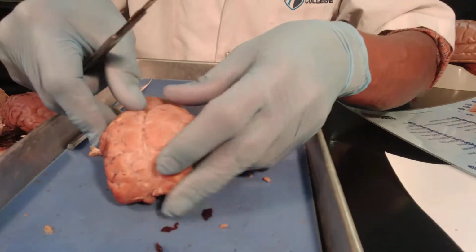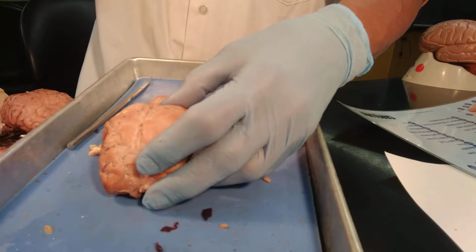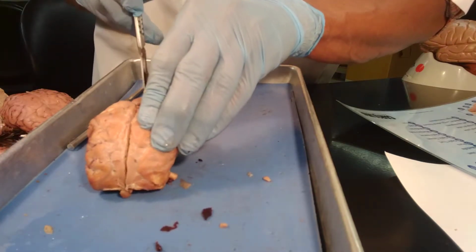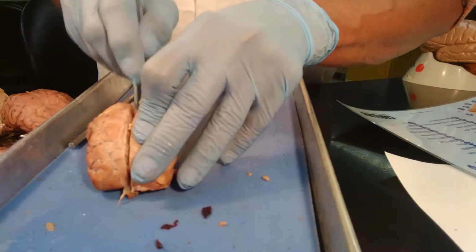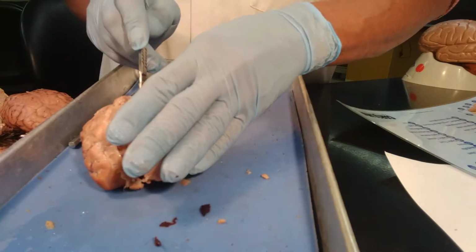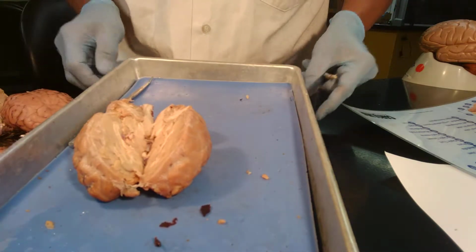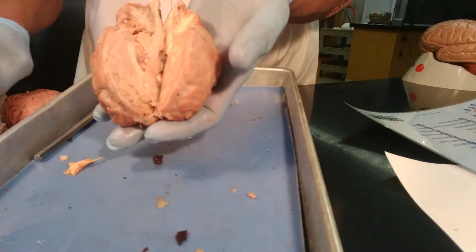Good practice is to hold it real well down, and I'm going to try to do the best I can. Going in the middle, trying to do the best we can, and make an incision along the midline that will cut the brain into two equal, hopefully two equal hemispheres, to obtain nice sections. Well, that's not too bad if you take a look at it here. I'll push it a little bit for you, and maybe put it up for you to look at.